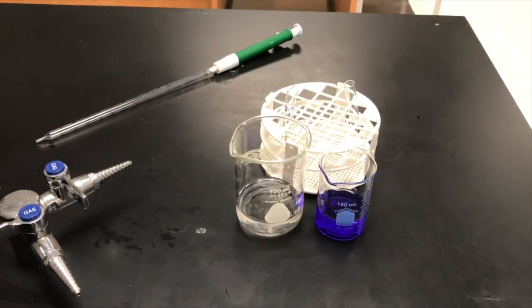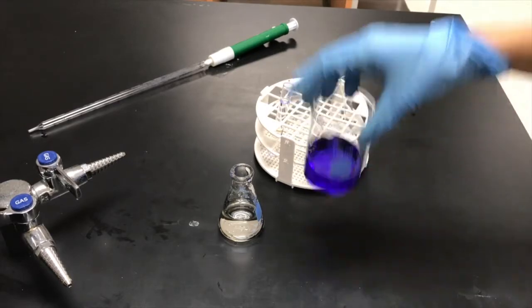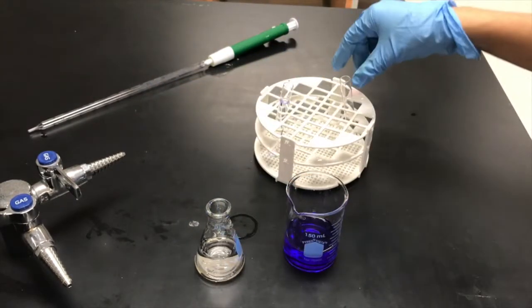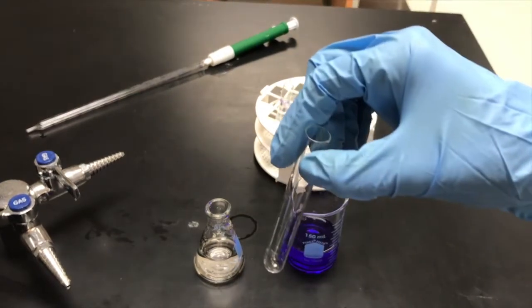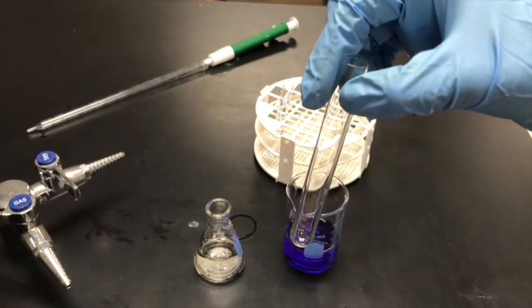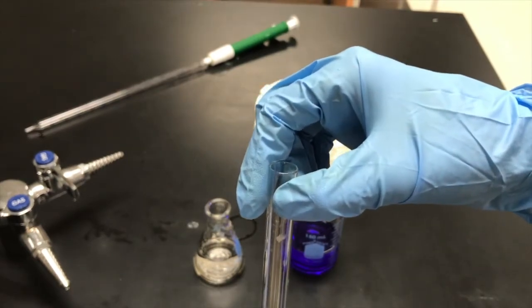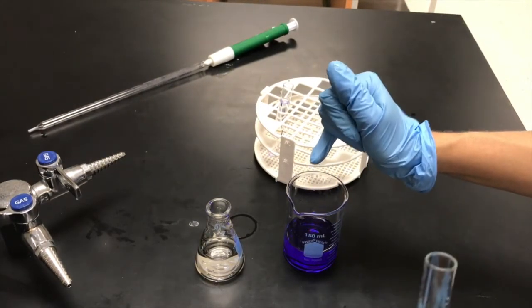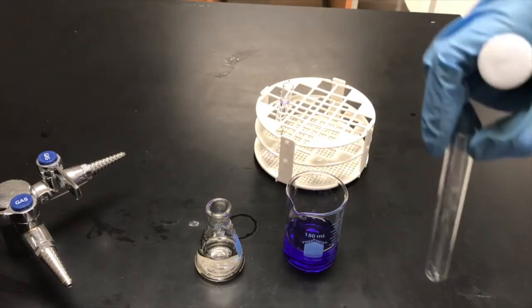Once you've done that, we move on to the kinetics of crystal violet. For the actual reaction, we're using 25 micromolar crystal violet and 0.02 molar sodium hydroxide — five mils of each added to the cuvette. As soon as you add them, immediately put the cuvette into the spectrophotometer and measure the absorbance every 20 seconds. The sodium hydroxide reacts with the crystal violet, causing the color to change, and we can quantitatively measure that change in absorbance.